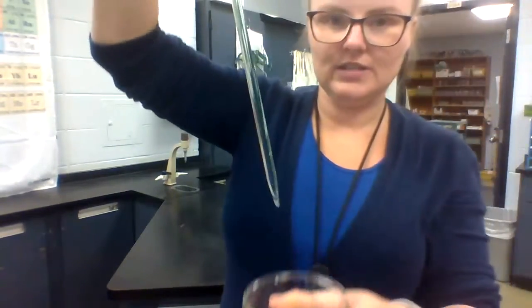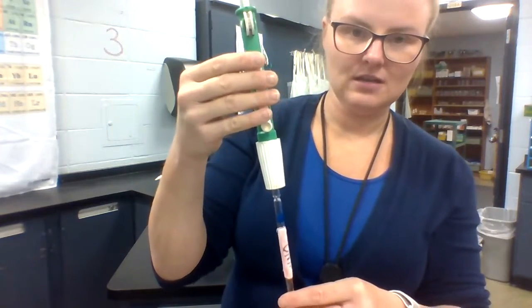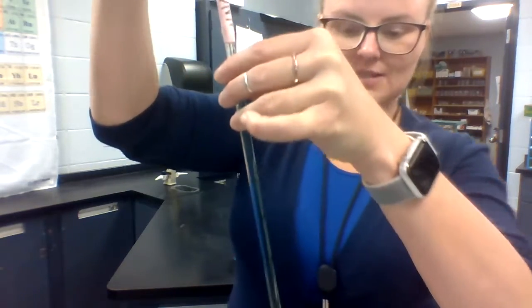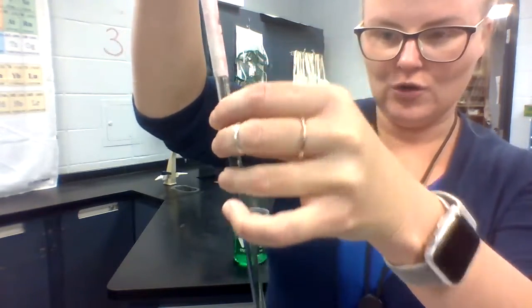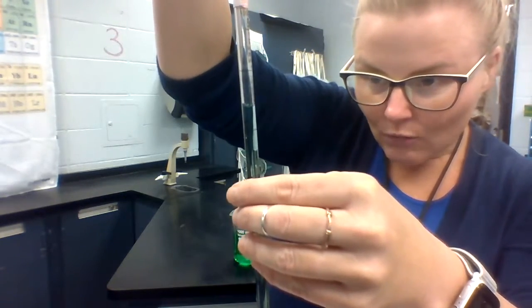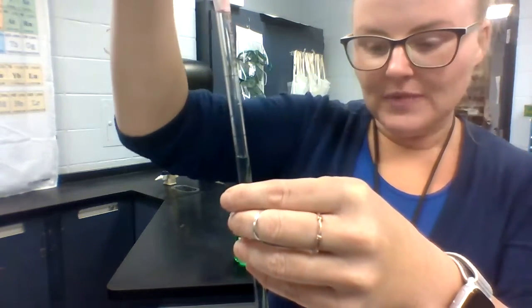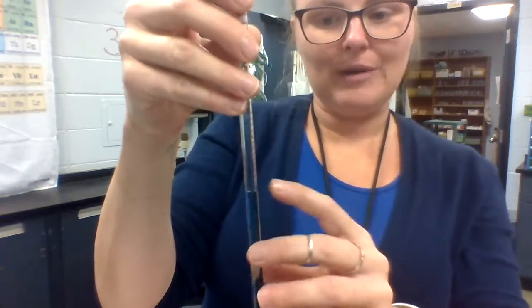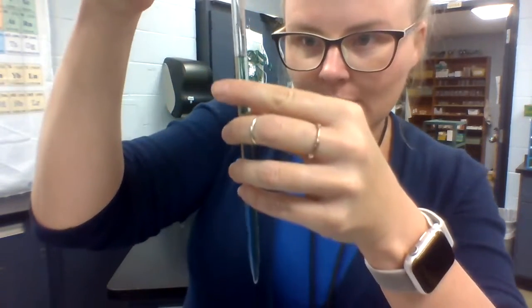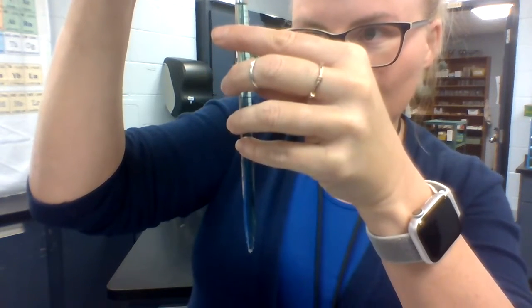To do that, I'm going to just gently squeeze this release button, slowly enough that I can kind of watch it travel, and I'm going to go down to about one point two three. I tried to hit 1.23 but I actually went a little bit beyond that, so we need to record that number — it is 1.34.